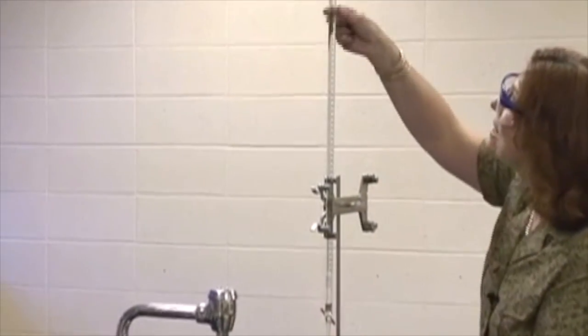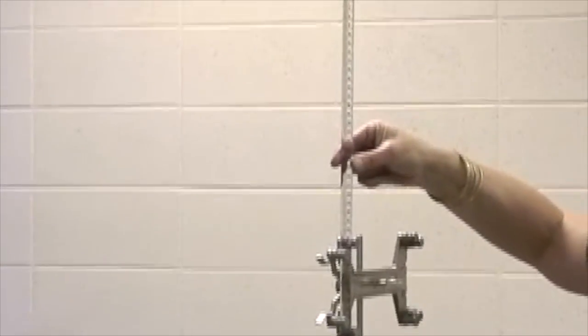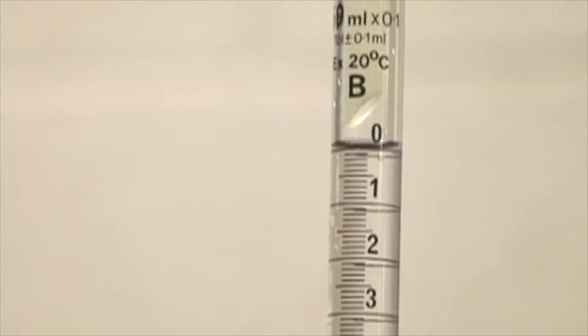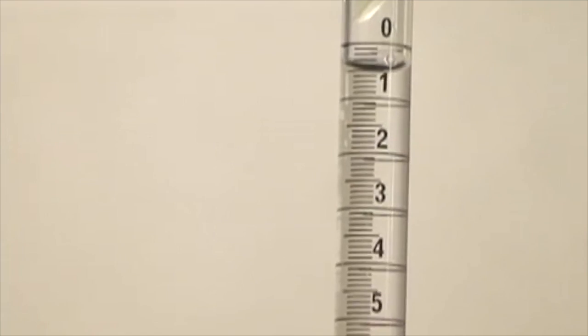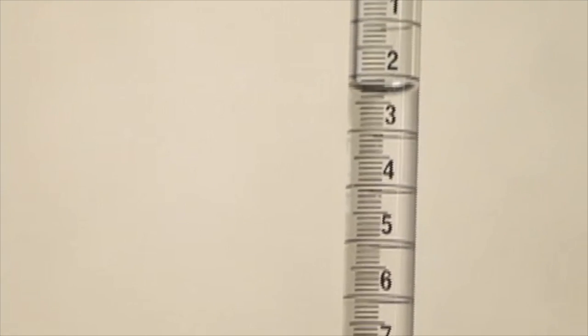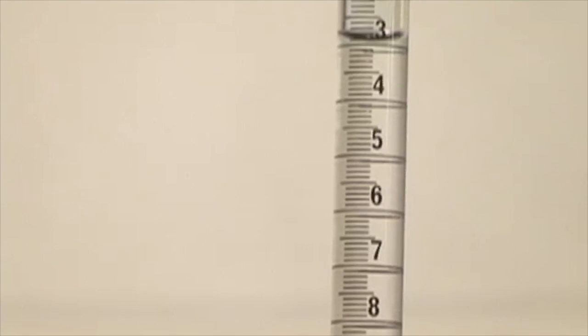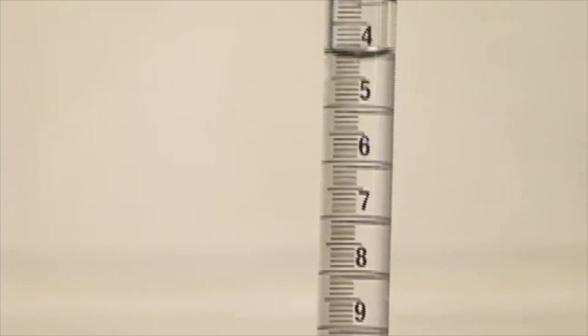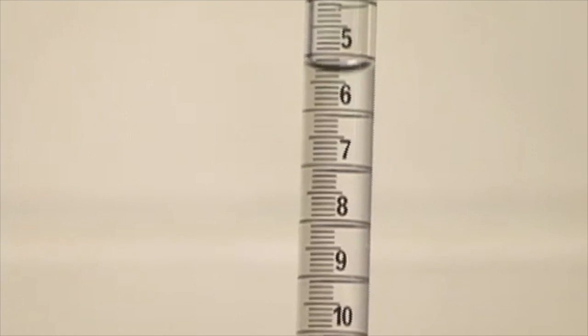The liquid inside of this burette is called a titrant, and that's what I'm using to determine the concentration of this base. The first time I may overshoot it because I'm not quite sure what volume it will require, and I want to keep a pink color for 30 seconds. I continue to swirl as it is dropping in there. Then when I see that the pink is lasting longer, I will slow it down to drop by drop.